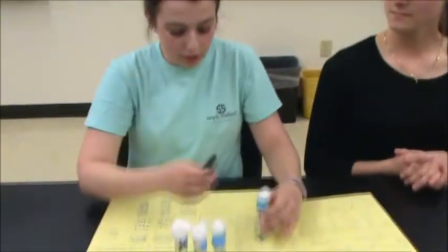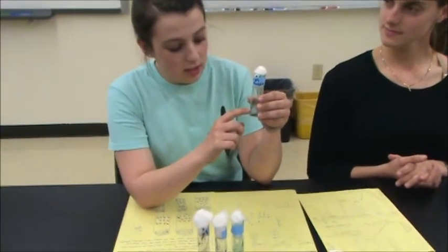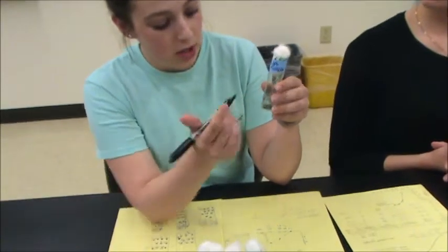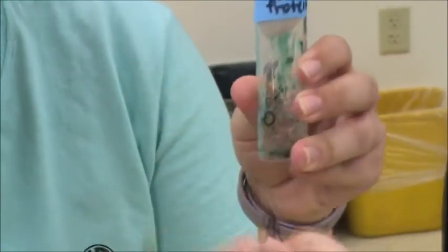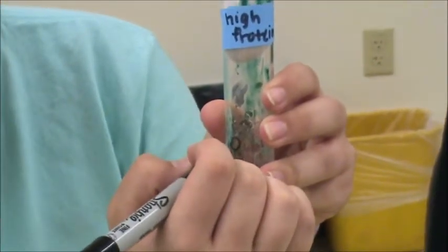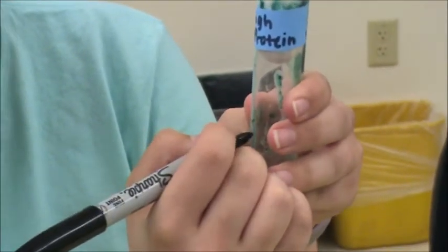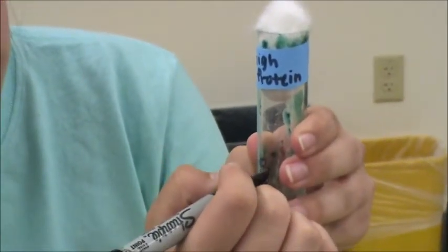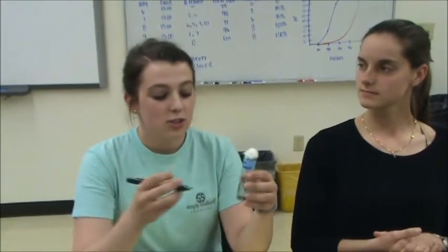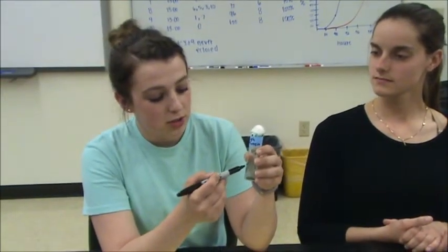So you're going to take a marker. Once the larvae have climbed up the wall, you're going to take your marker and circle each larva, and then give them a number. So like this is 1, here's another one, label that 2, 3, and so on. Okay, so once you've marked this one, you keep marking them until all of them have eclosed, or in some cases some will die, and then that's it.